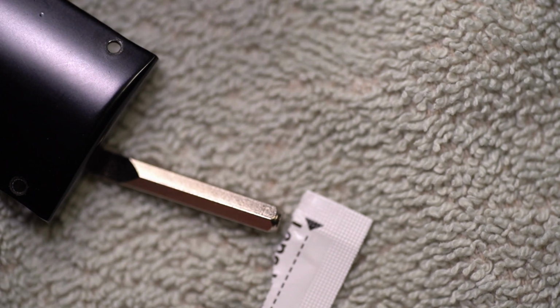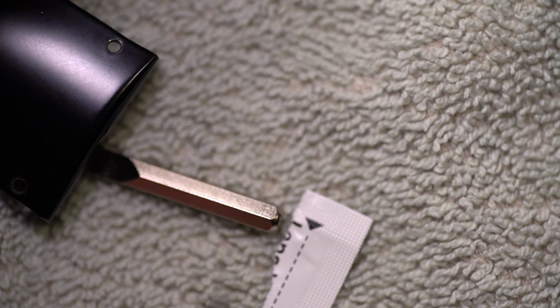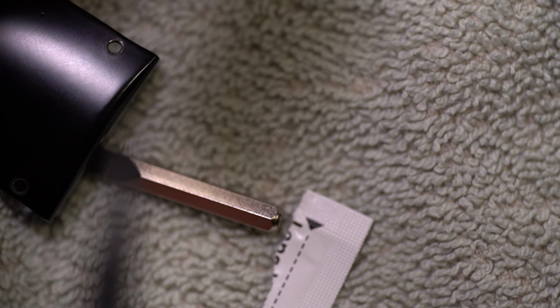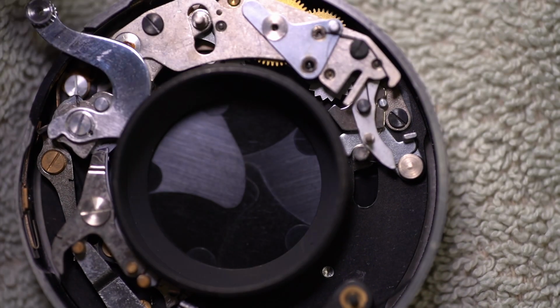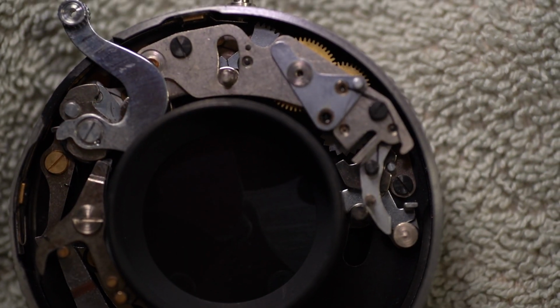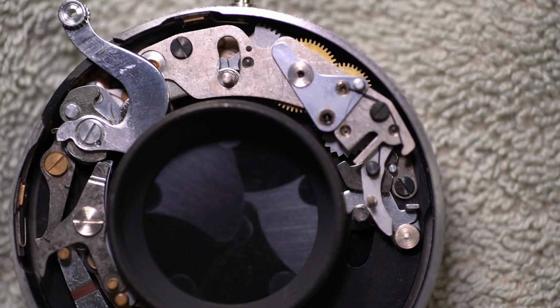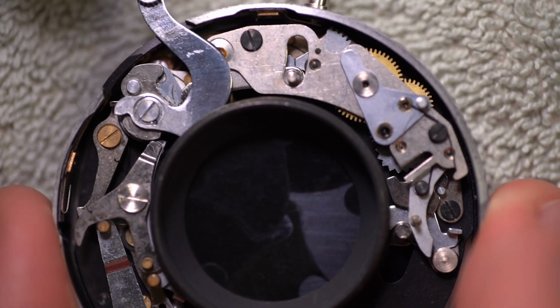So that's why in the adapter part that I'm working on, there is an iris type. I forget, I think it's an iris type. It's the same type of shutter as the aperture in a camera, and it looks like this. In fact, this is it. And what goes on is you cock it with this lever. A bunch of cool stuff happens in there. I'm just going to see if I can get this all in focus a little bit better. Brighten that up a little bit so you can see it better, maybe. Cock it with that. Once it's cocked, it doesn't really do anything else.